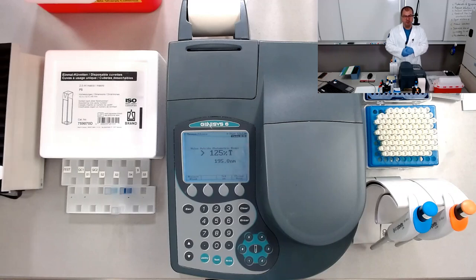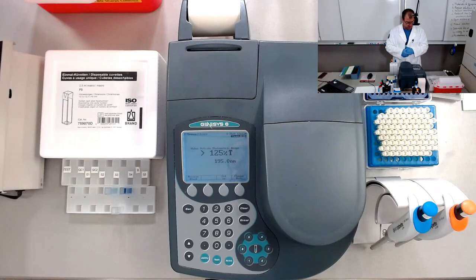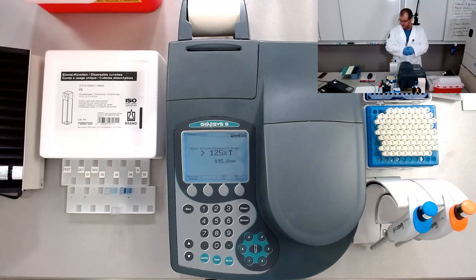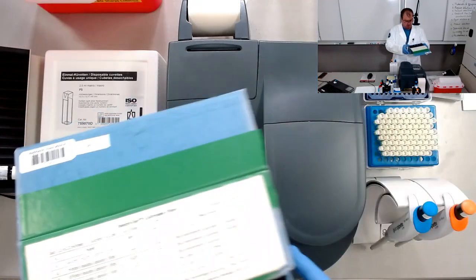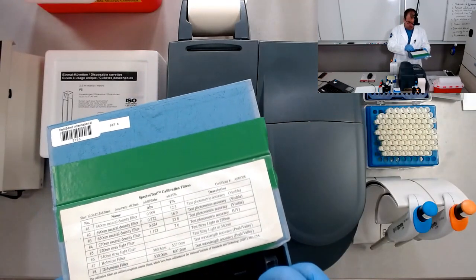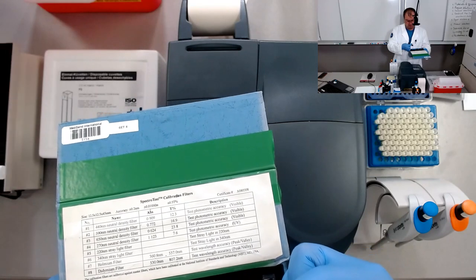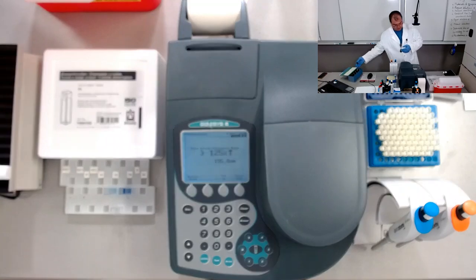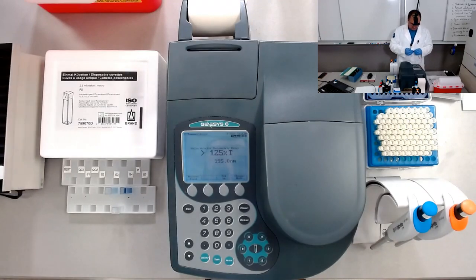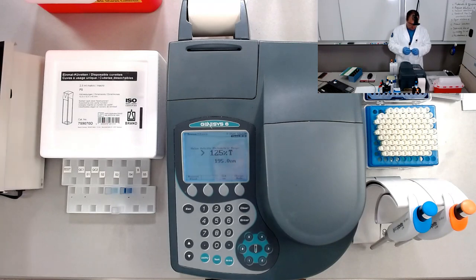Hi, I'm Costel. In this video I'm going to show you how I get the absorption spectrum of a particular element. This element will be holmium, which is deposited on a filter used in calibrations later on. So let's determine the absorption spectrum with this spectrophotometer, Genesys 6, developed by Thermo Scientific.